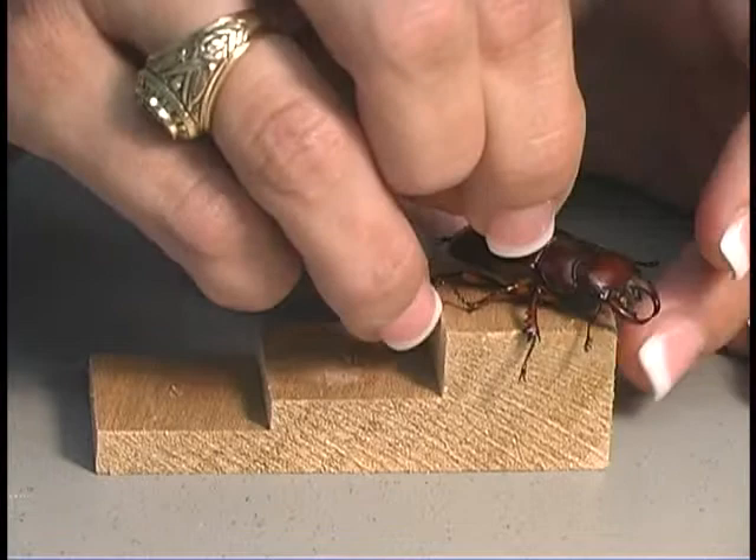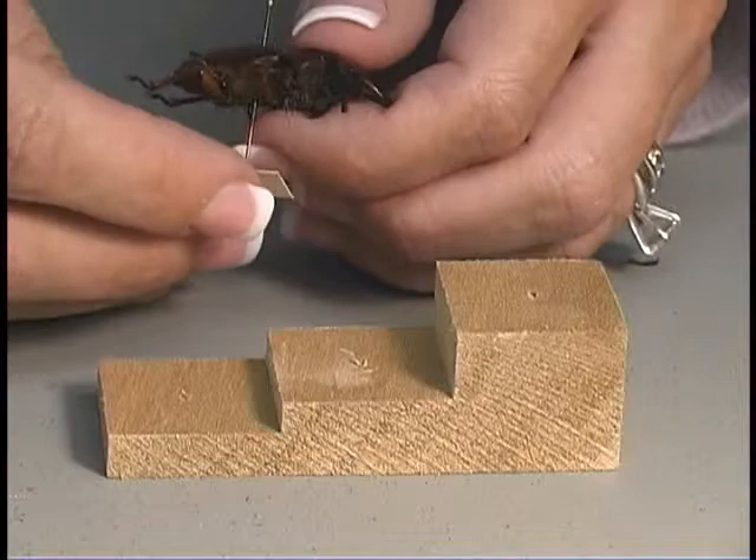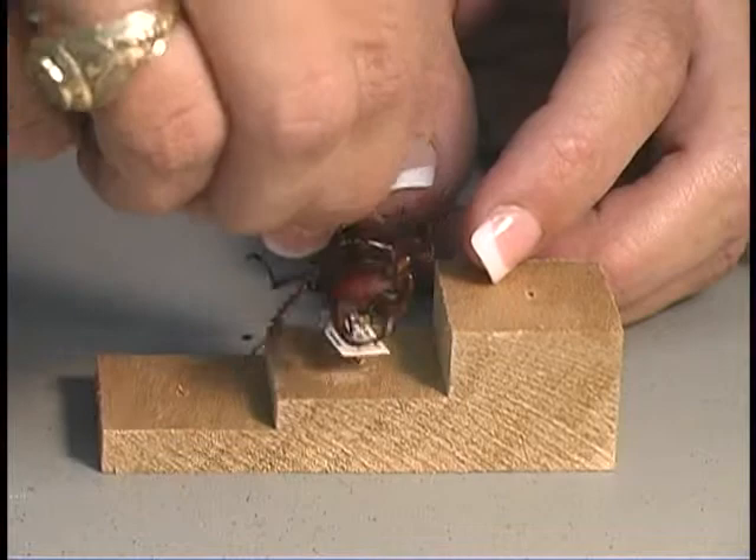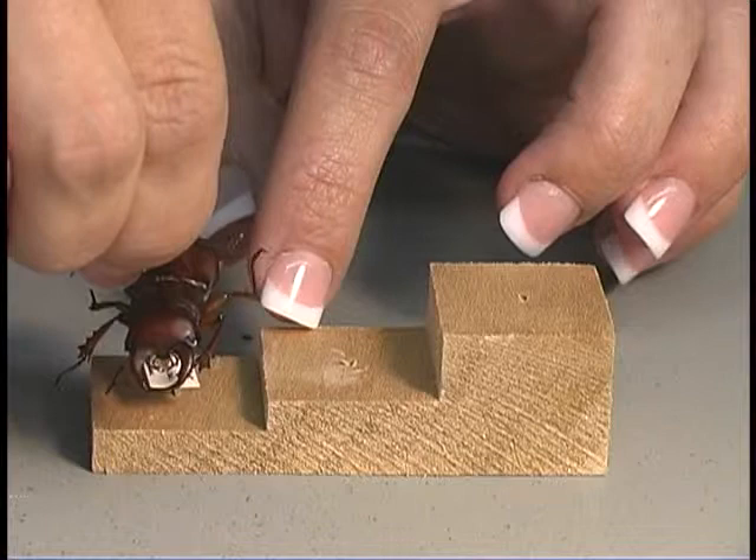Remove the pin to get it to the proper height, then put the label next, and place it in block two to get the label height as needed. If you have a secondary label for the genus, species, and author of the insect, it would go at the third height.